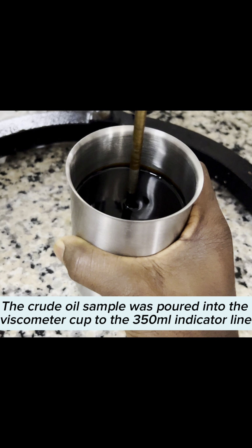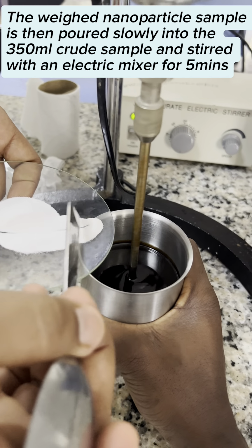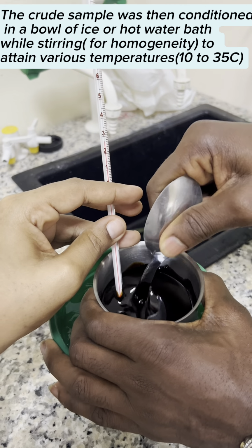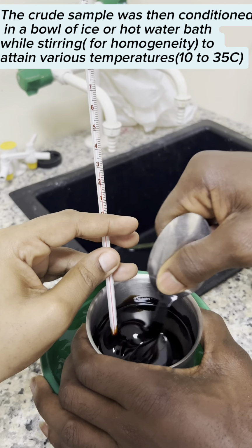The crude oil sample was poured into the viscometer cup to the 350 ml indicator line. For the crude sample and nanoparticle viscosity test, 7 grams of nanoparticle, which is 2% by weight of the 350 ml of crude, was weighed. The weighed nanoparticle sample is then poured slowly into the 350 ml crude sample and stirred with an electric mixer for 5 minutes. The crude sample was then conditioned in a bowl of ice or hot water bath while stirring for homogeneity to attain various temperatures.